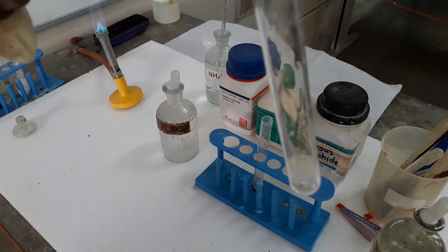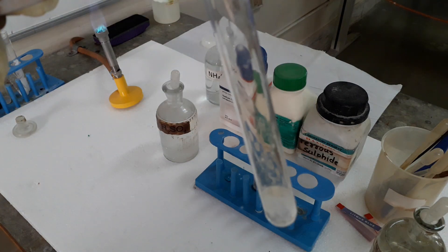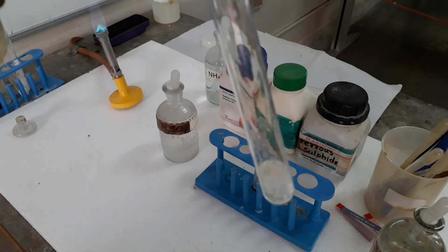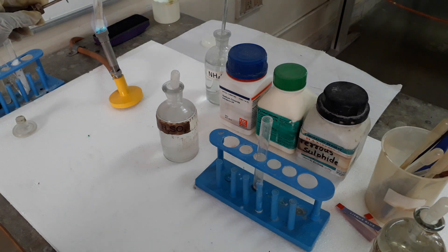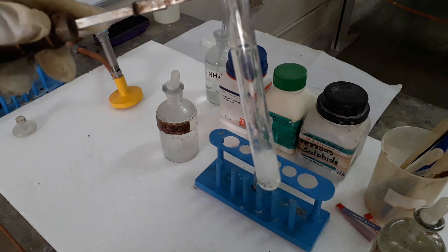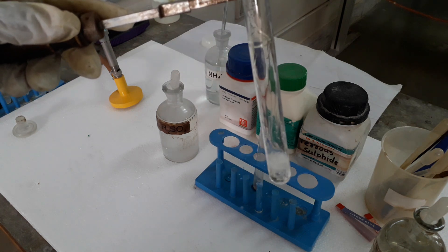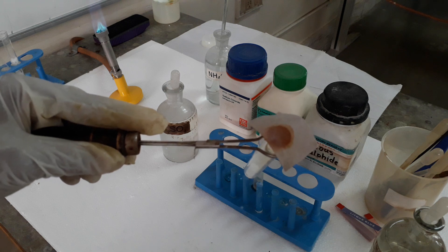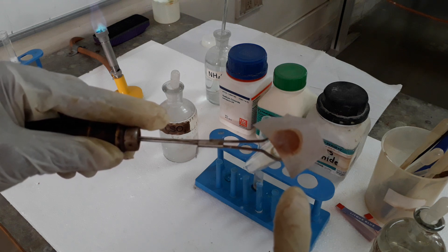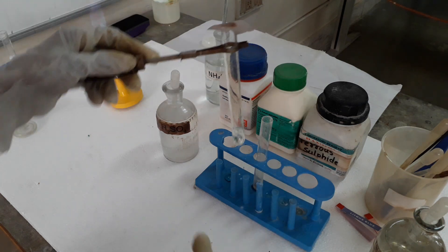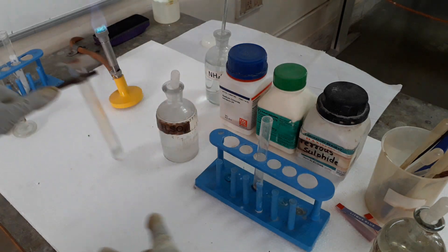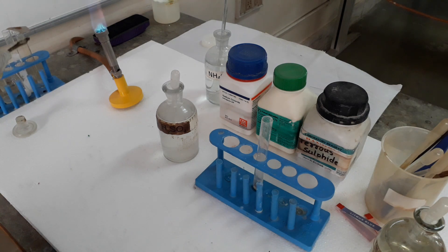Reddish brown fumes will start coming out. You can see slight reddish brown fumes, and these are actually nitrogen dioxide gas. The nitric acid which is formed will further decompose into nitrogen dioxide. This nitrogen dioxide turns KI paper brown, confirming that the anion is nitrate, NO3 minus.